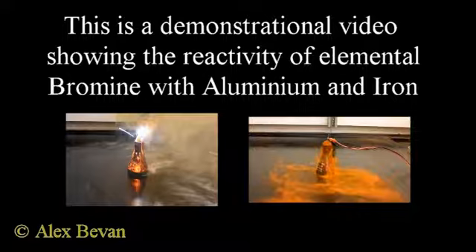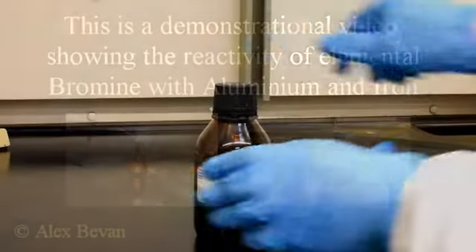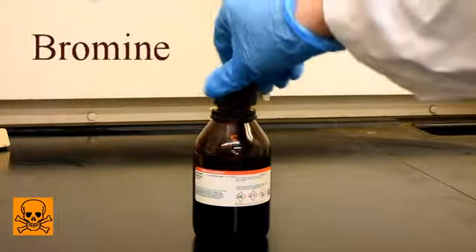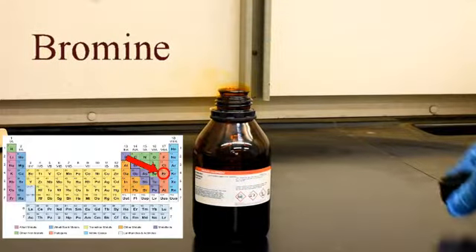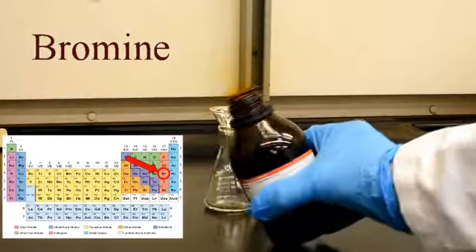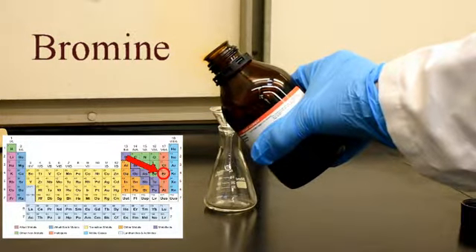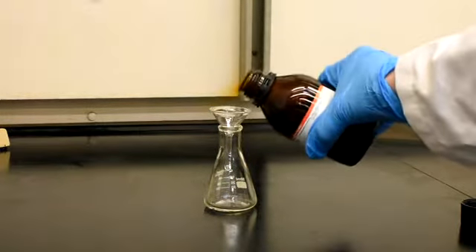This is a demonstration video looking at some of the chemical characteristics of elemental bromine and some of the chemical reactions between aluminium and bromine and iron and bromine. Bromine is positioned as a halogen in the periodic table, and the natural state of bromine at normal temperature and pressure is a liquid.